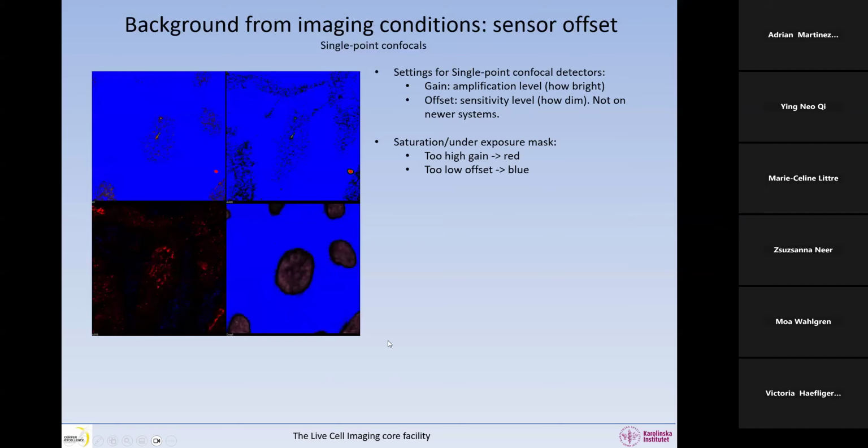So in this image, we have color-coded the saturated pixels in red and the underexposed pixels in blue. So you can see here we have this saturation and underexposure mask on in this image. And what you can see is that we have saturated pixels, they're red, and that we have really a solid blue background like this. And we will see the consequences of doing something like this. So here we have a low detector offset. It means you will get a very nice, once you remove this mask, the background will be very black. Oh, lovely. But the problem is the offset is too low. So what happens if the offset is too low here? We're going to get a solid black in the background. There will be no nuances, no little variation in the background.